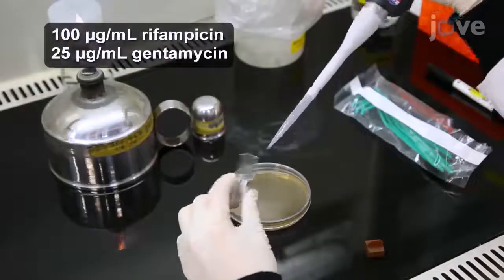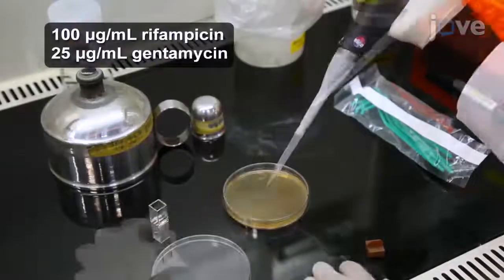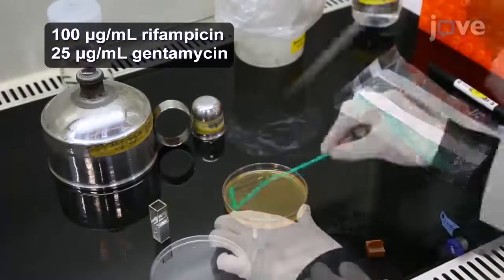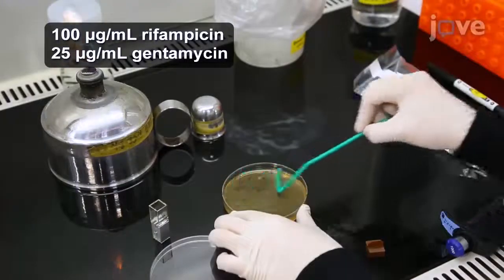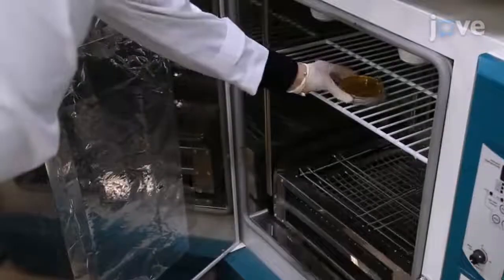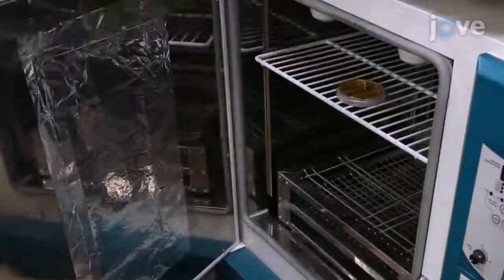Gently spread the transformed bacterial cells over the surface of King's B agar plates. Then incubate the plates at 28 degrees Celsius for two days.